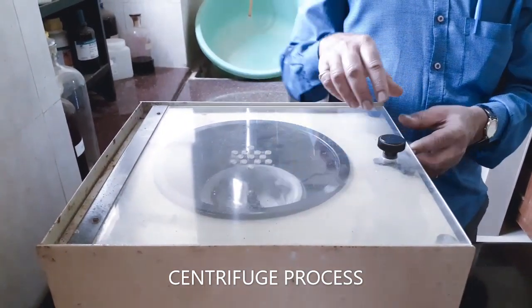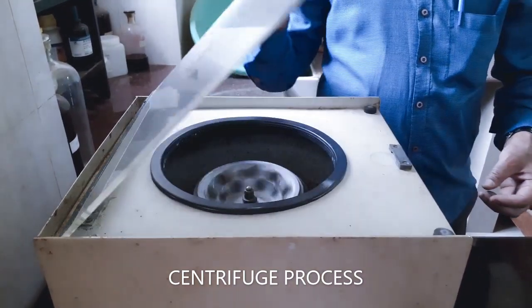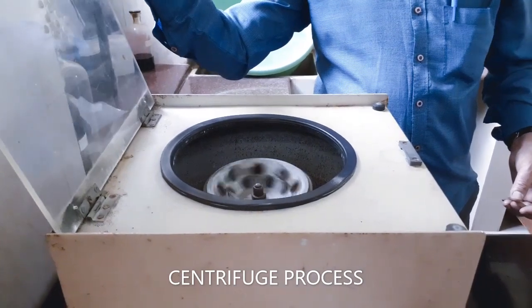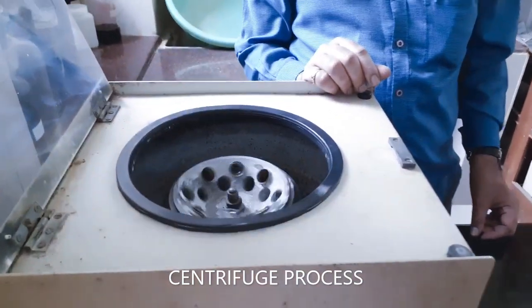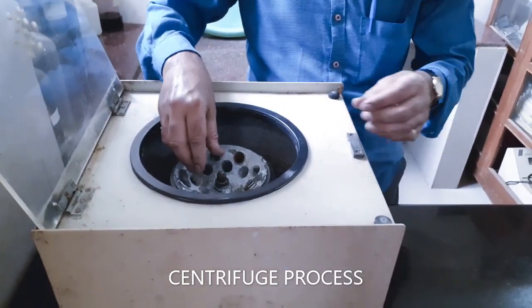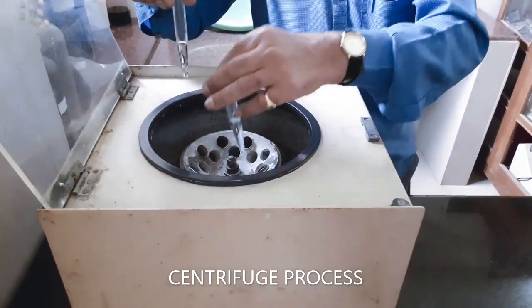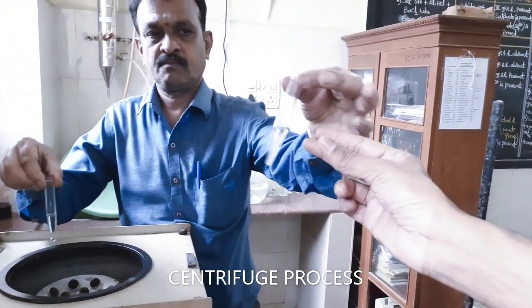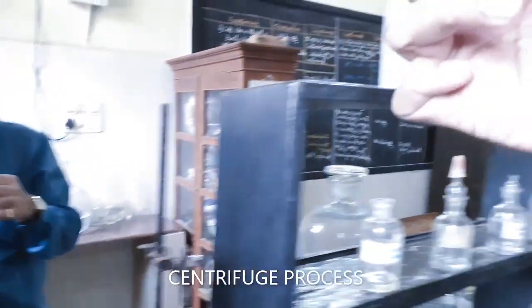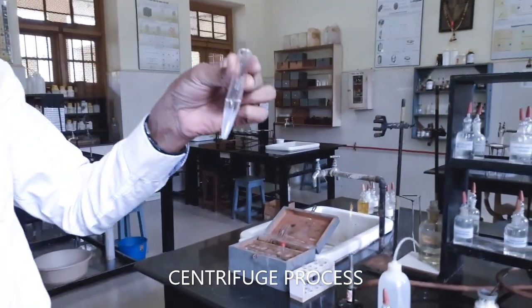The centrifuge machine rotating motion stops. Now Mr. Ganesh Reddy is taking out the centrifuge tube from the centrifuge machine. Now you see centrifugation is over. The residue is settled, white gelatinous precipitate, and that is called residue, which is aluminum hydroxide.